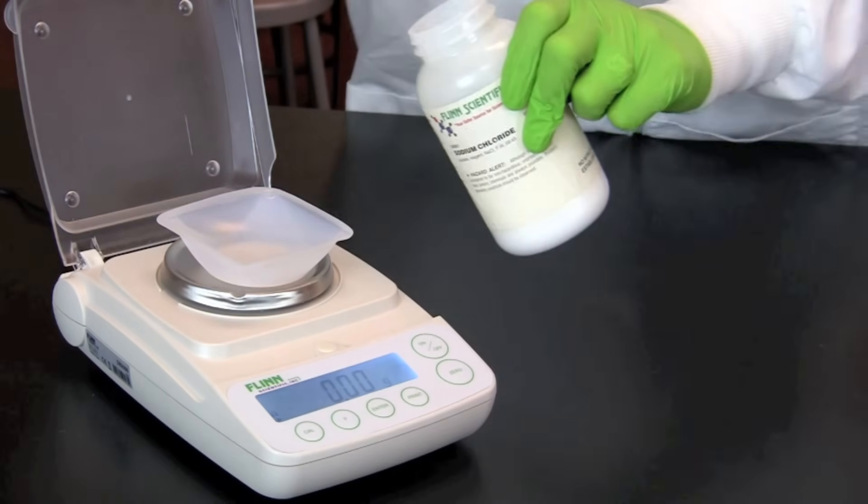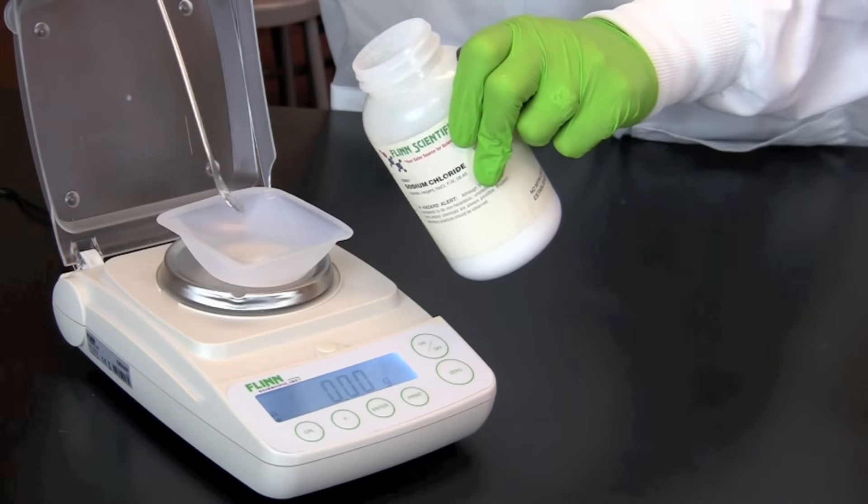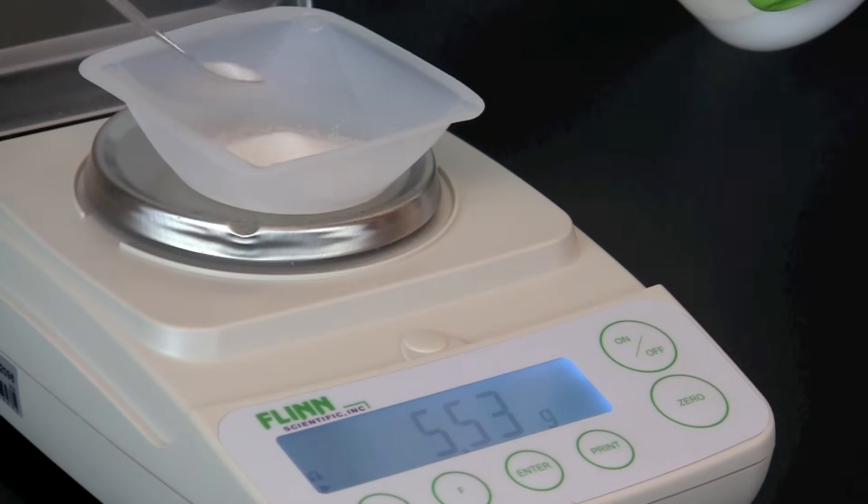Using a spatula, slowly add the material that you are weighing into the weigh boat. Continue to add material until you reach the amount of the material that you want.